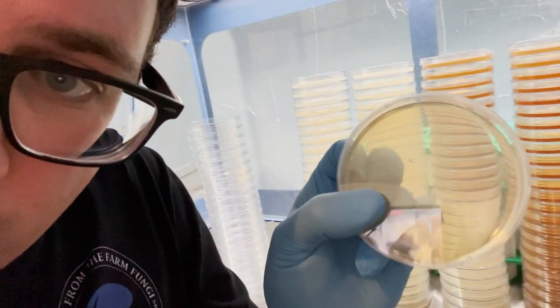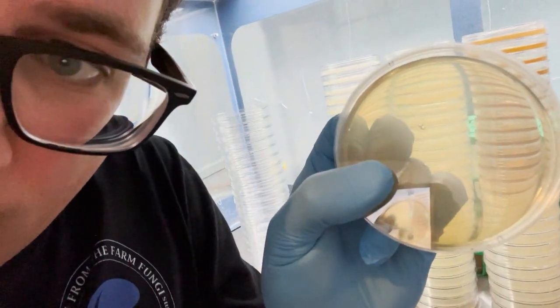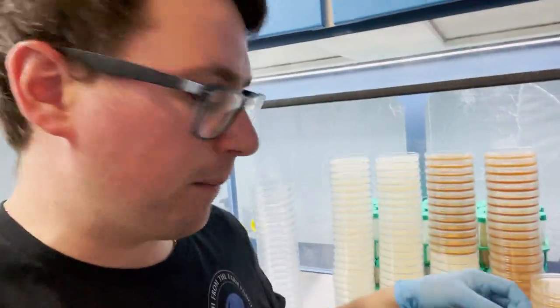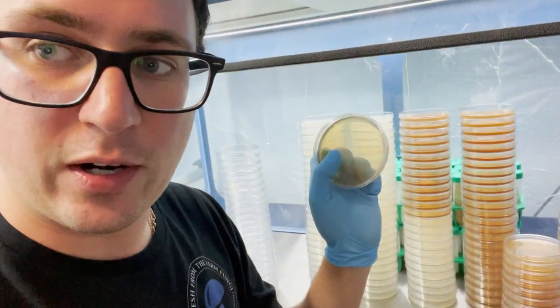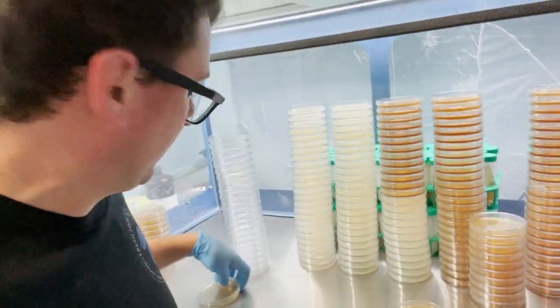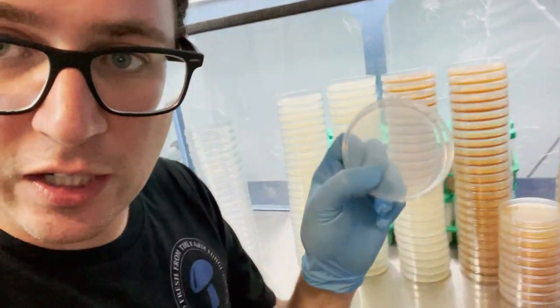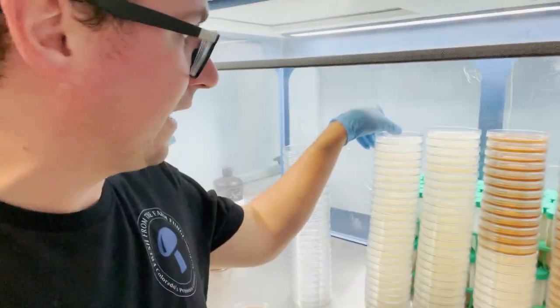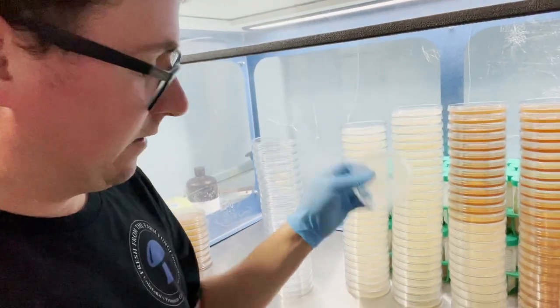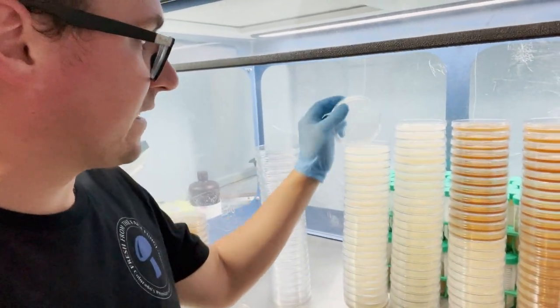You can see on this one that there's some air bubbles. So that was from when I was mixing the jars, it creates some air bubbles. It's not going to affect the growth or anything, but I usually save these for my own production. And then if you just look, you can see how nice and clear these plates are.